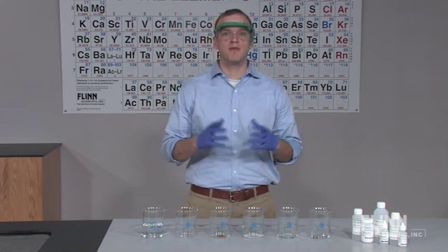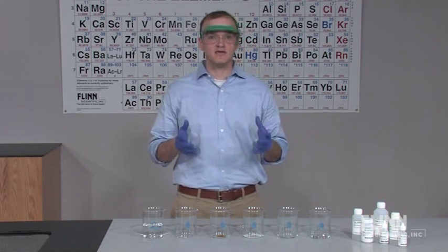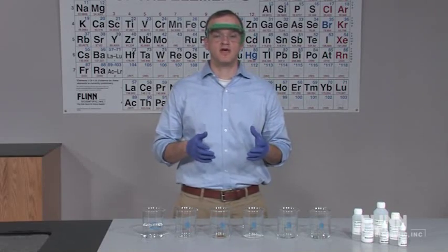This discrepant event demonstration will amaze students and make them think about acid-base chemistry, solubility, and precipitation reactions.